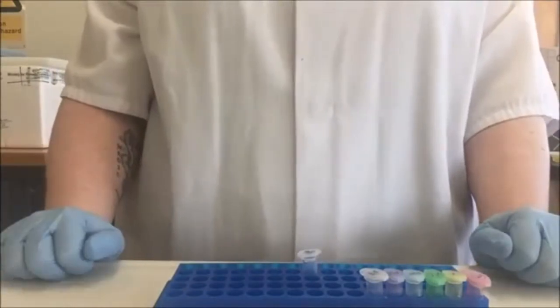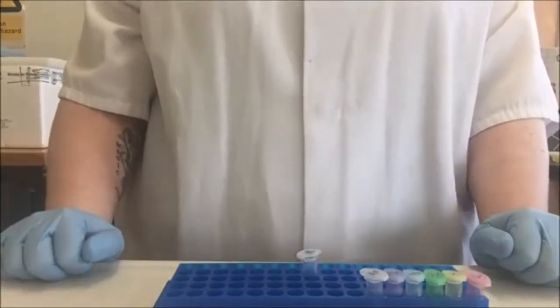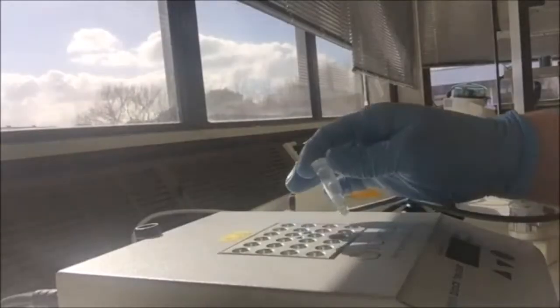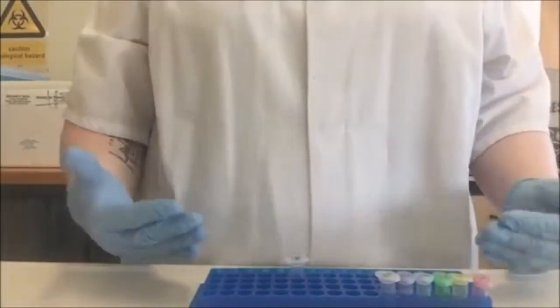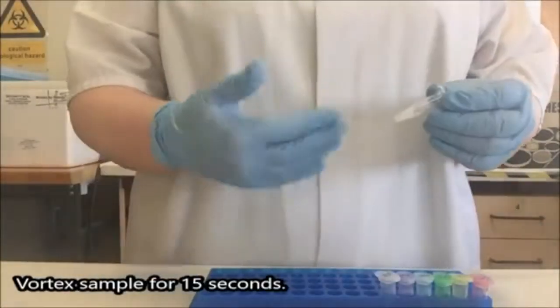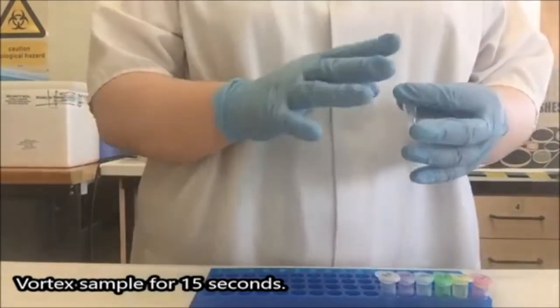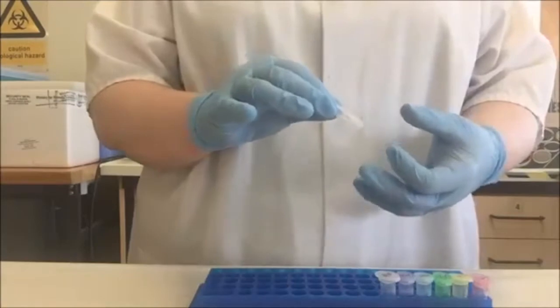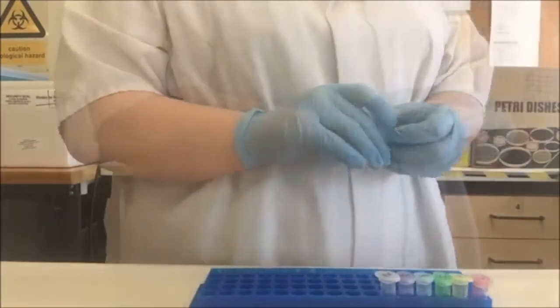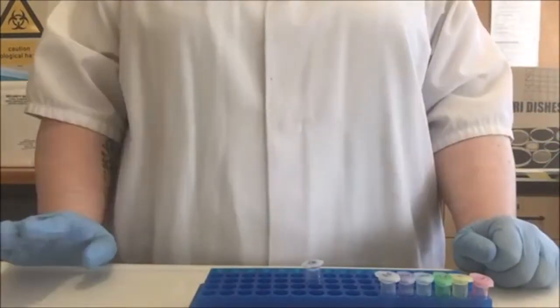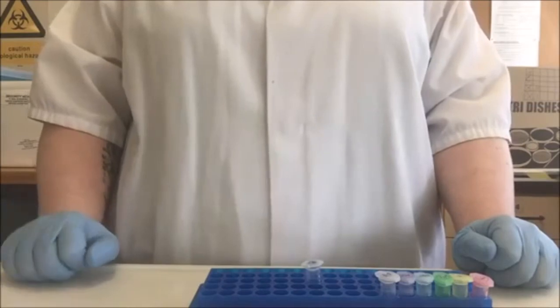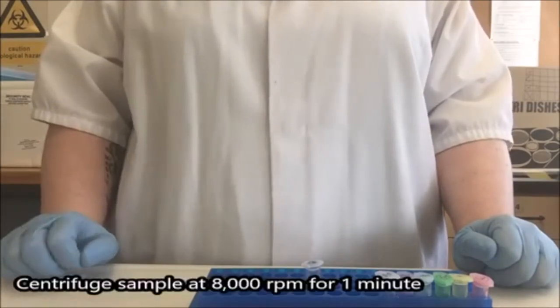The next thing I need to do is incubate this at 56 degrees for 20 minutes. So our 20 minutes are up. I'm going to take my sample and I'm going to vortex it for 15 seconds. The idea here is to get the liquids moving around a lot. Make sure that any cellular debris that's in the solution is well mixed.